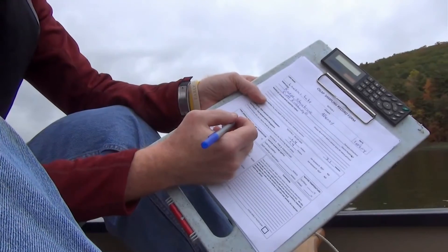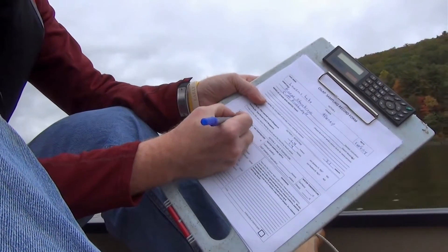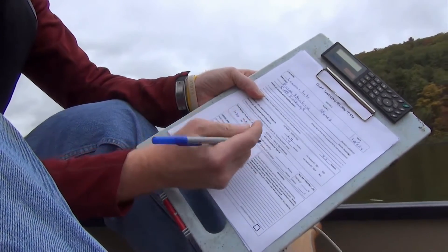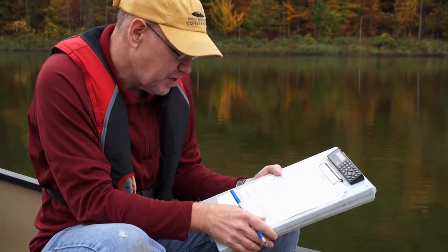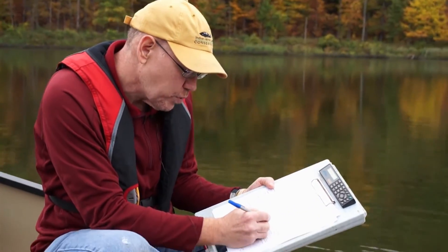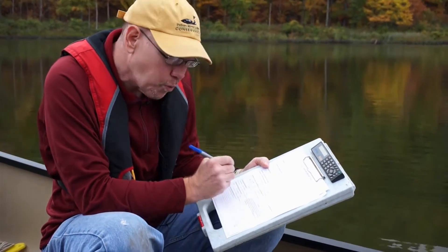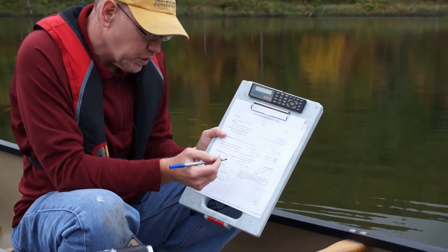The first question asks for the time in military hours. We'll place that information and check the box for a.m. or p.m. Then you'll record the water sample depth, which again was at 1.5 meters — your surface sample will always be at 1.5 meters. And then you'll record the water temperature once you know that.